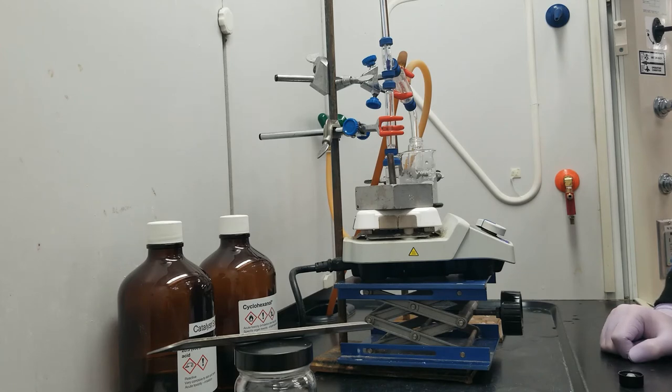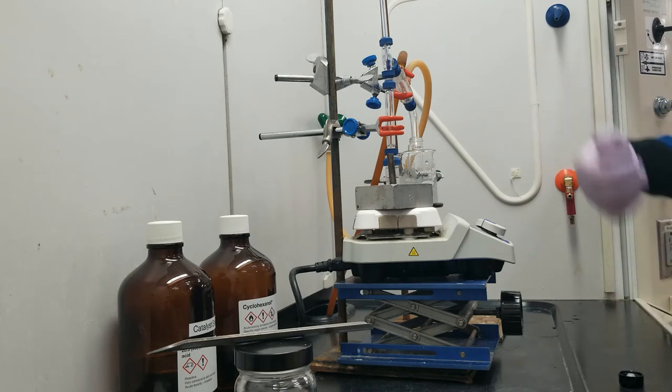So I'm going to let this heat up for a few minutes and we'll come back once we have the distillation and product going.